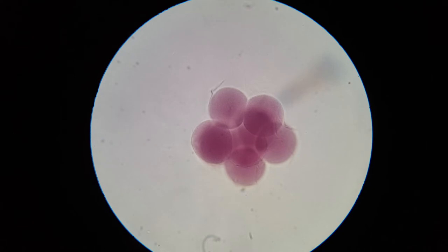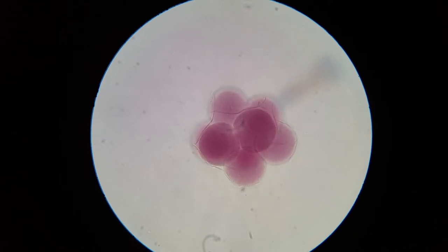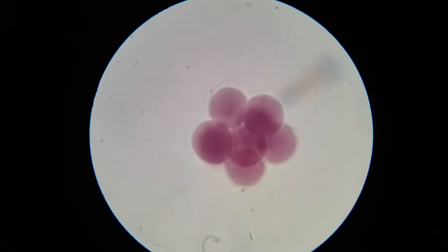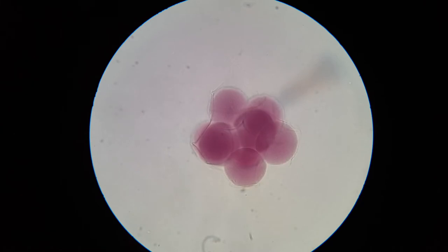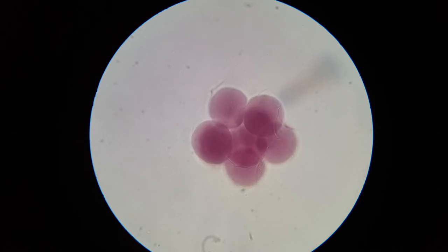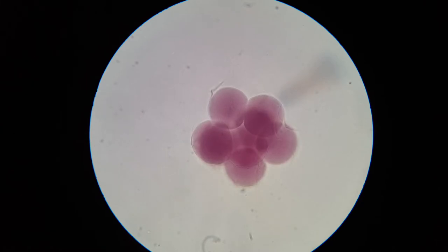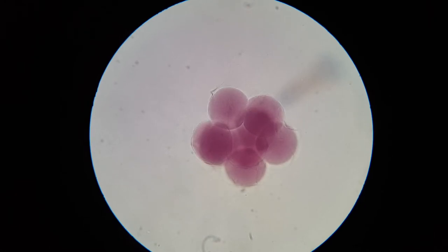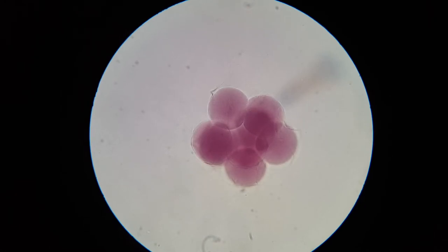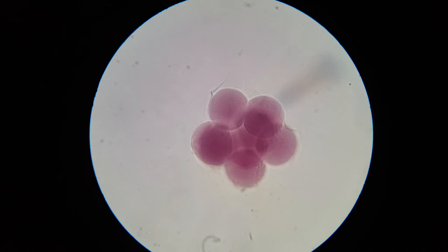You can see four cells on top and four cells on the bottom — doesn't get any better than that. Starfish eight cells. So we went through three rounds of cleavage: one times two is two, two times two is four, and four times two is eight.